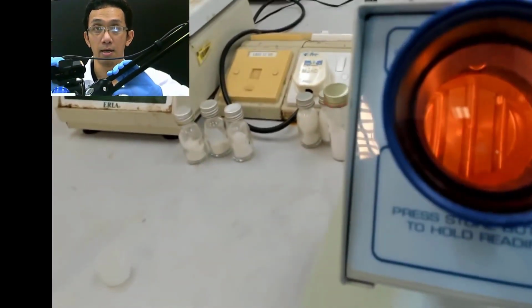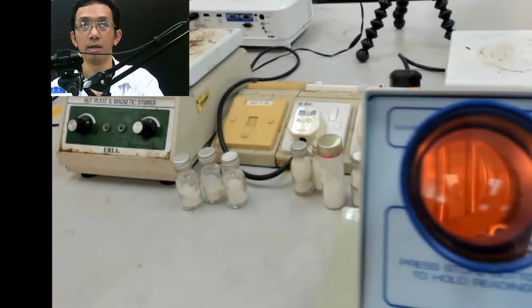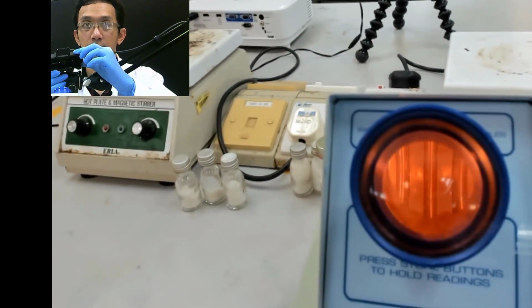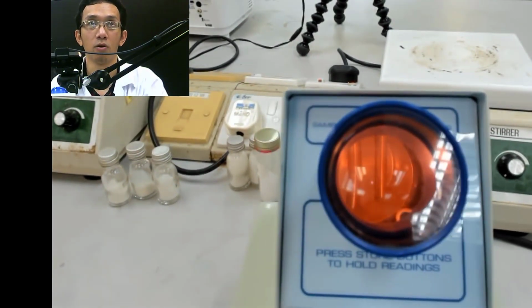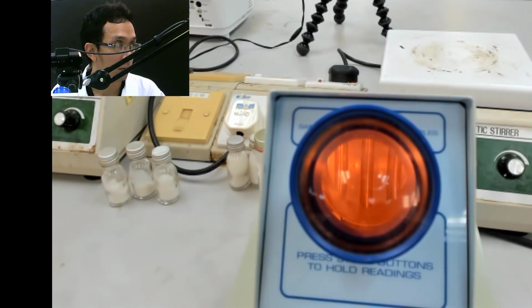So let me show you what is inside this first. Can you see that? Yes, sir. Okay. It's because I just use a webcam, so the focus is not really good. But I hope you can survive. Let me go further first.